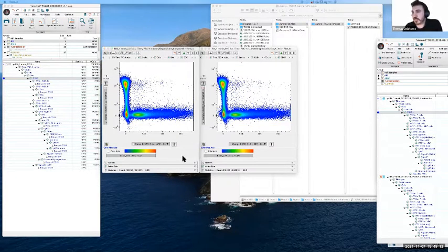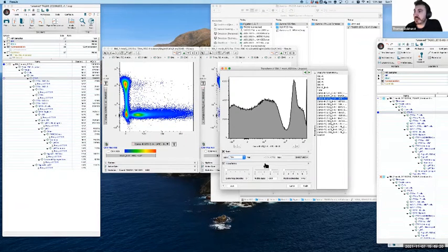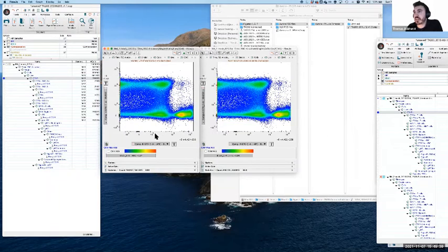Now, because that's not the actual question, I will deal with the actual question, which is probably more important. So this is something you can do here with FlowJo in particular: there is a control here, which in this case is called the width basis. When we're trying to troubleshoot things like compensation or spreading error, we make a decision that at data below a certain value, we're looking at autofluorescence or background. So I'm just going to hit apply for this one.